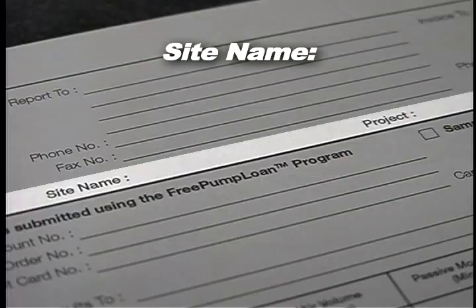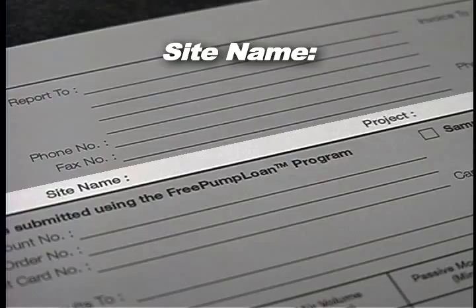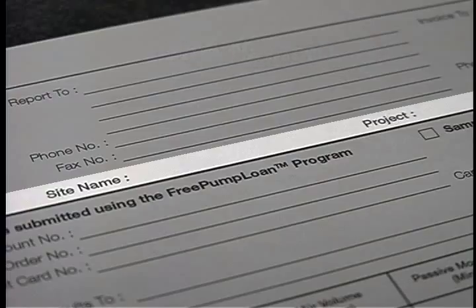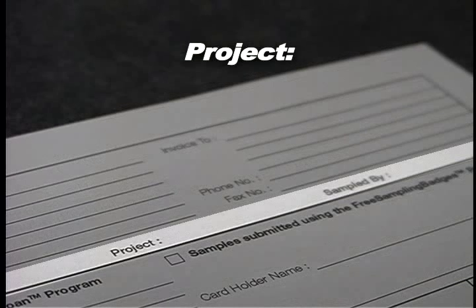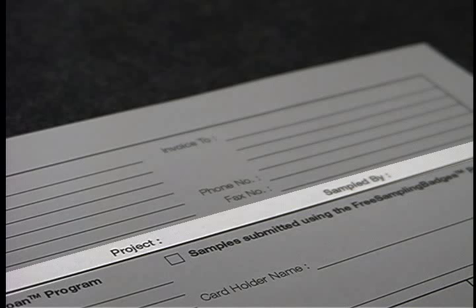Site: Provide your own identifier as a site reference if applicable. This site will be reported on each page of the final report. Please write legibly, as site names are not always obvious to the laboratory and we often have to verify site names with the client if they cannot be read clearly. Project: Provide a project name or number if applicable. This name will be reported on each page of the results and is your own specific project name.